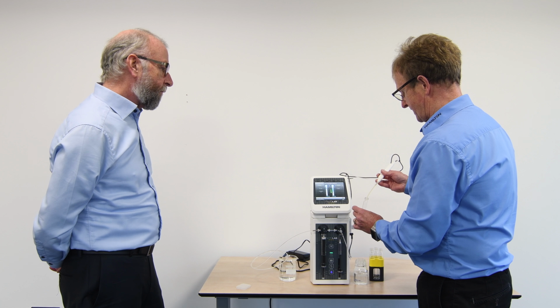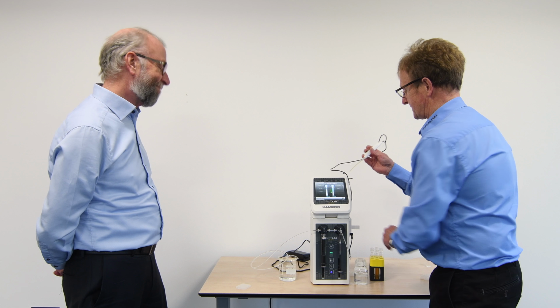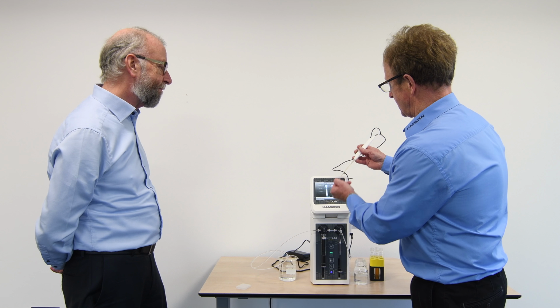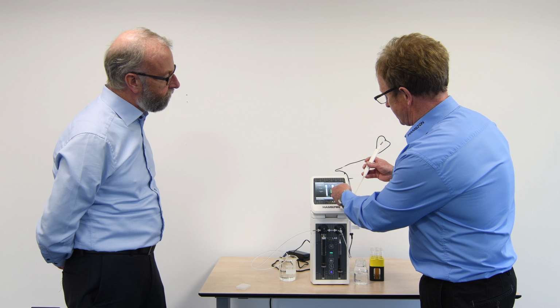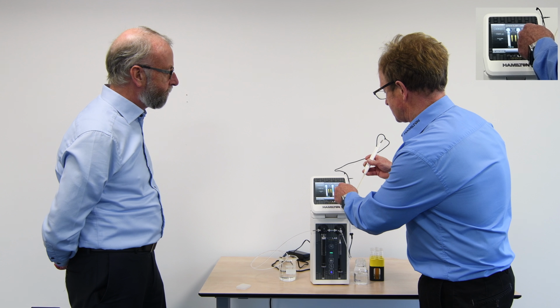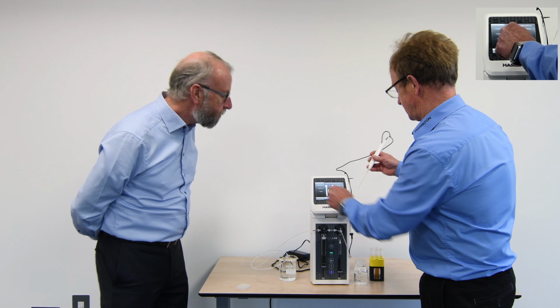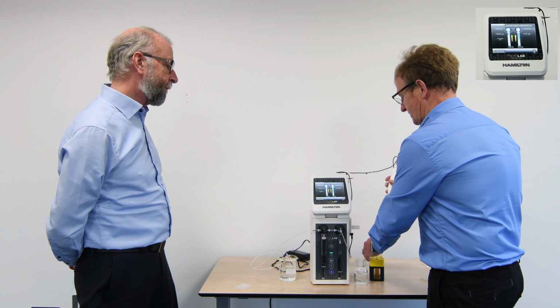Clearly, in the laboratory environment, I would be using my gloves. Much easier to use this here, where we're using the sample. I'm showing you some demonstration purposes. We can see in each stage picking up that 5 microlitre air gap is picked up. It's actually here showing us it's dispensing. The volumes are shown here. So the technician is in full control of what's going on with this process.